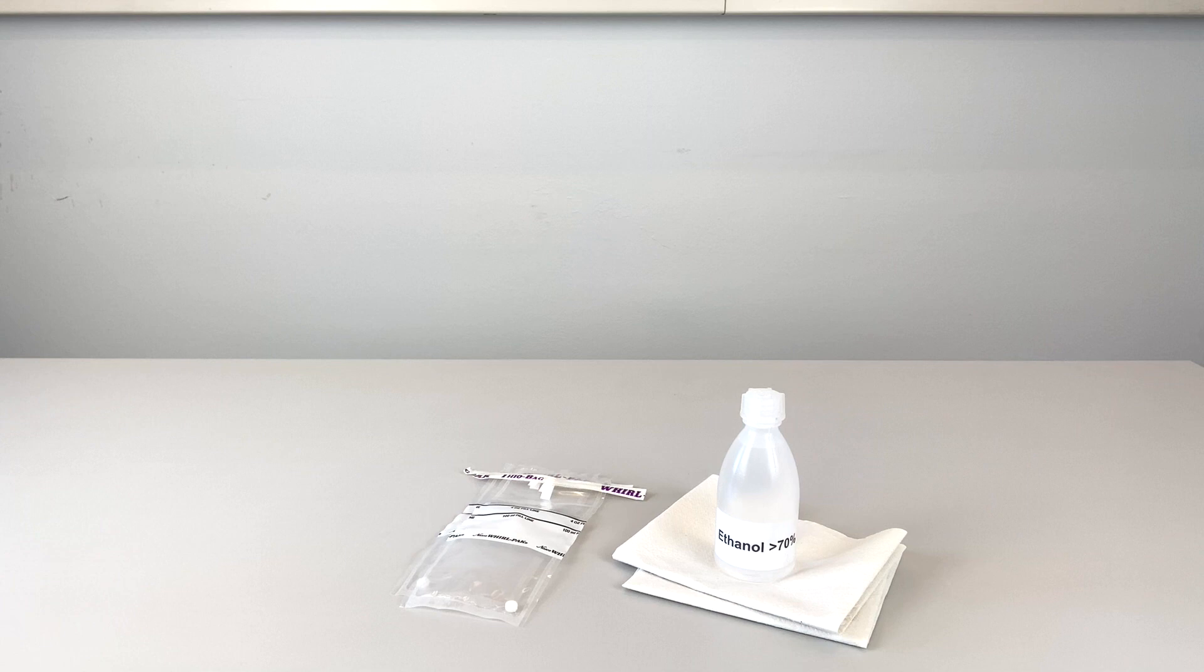The bags contain thiosulfate to remove possible chlorine residue. If you want to use reusable sampling bottles instead, read the standard to know how to handle the bottles before taking them for sampling.